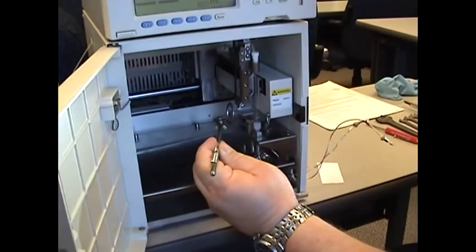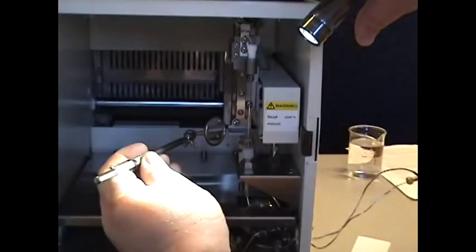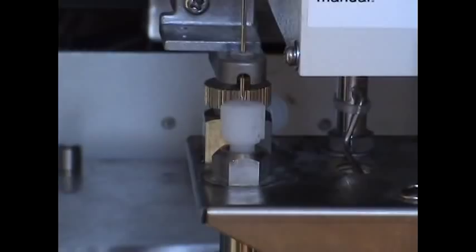To make sure that that is centered. And also, for the X direction, you can look at it straight forward. This is the way it should look. It should be right at the top plane of the injection port.